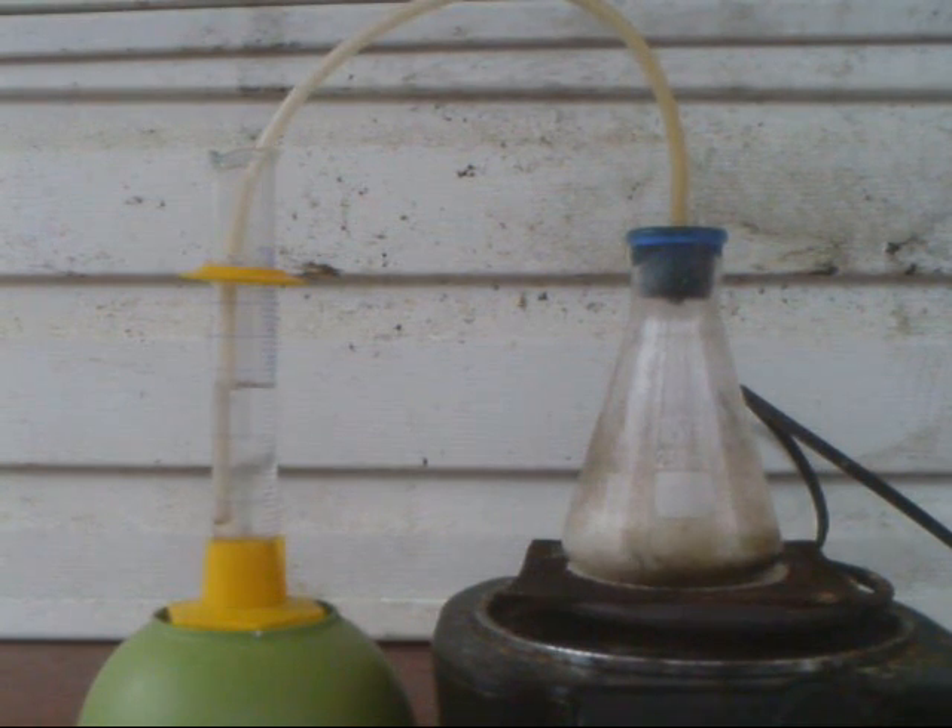Here's a sped-up video of me making the hydrochloric acid. But my flask breaks during the reaction, so I shut the video off. But I did make a batch earlier, which I'm grateful for, and I can still show you my finished product from the last reaction.